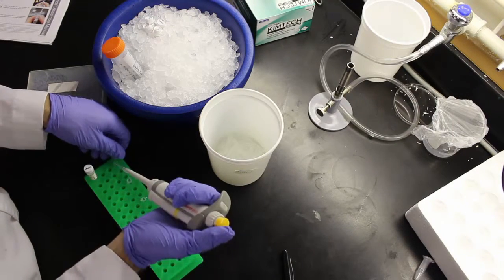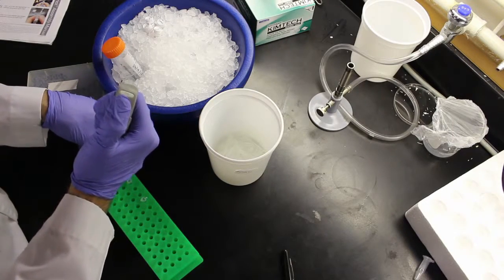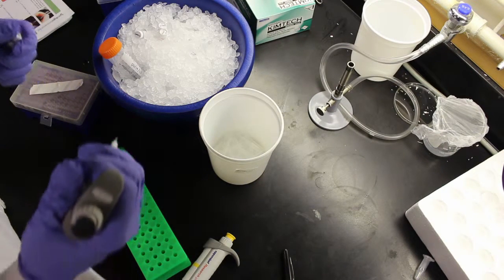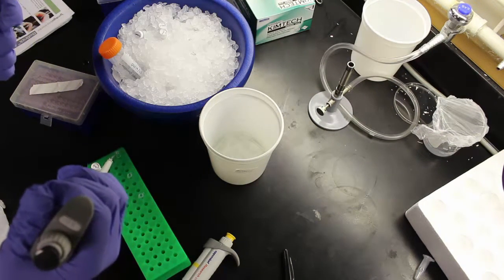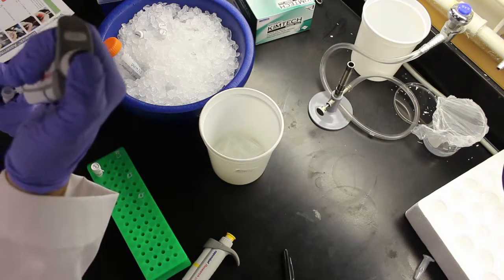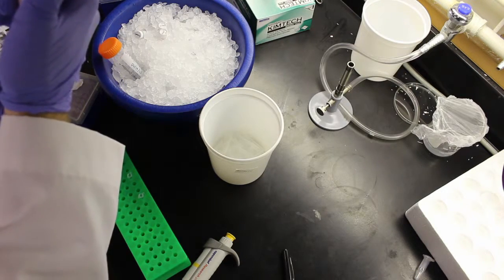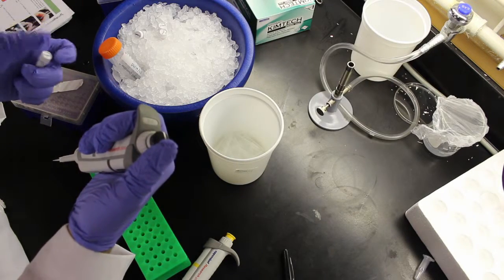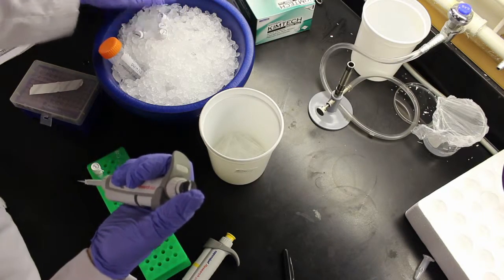Add 5 microliters of 10X restriction enzyme reaction buffer to each mix. Add 1 microliter of each appropriate restriction enzyme to a tube. For the upstream part, this will be EcoRI and SpeI. For downstream parts, the restriction enzymes are XbaI and PstI, and the vector is cleaved with EcoRI and PstI.